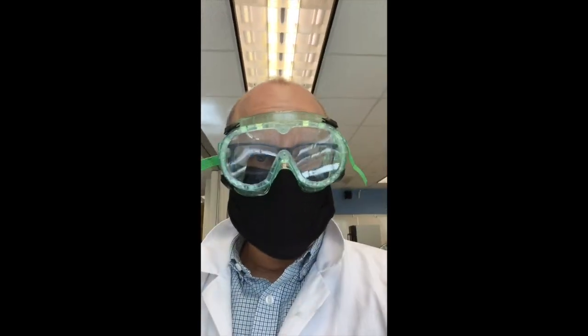All right, so what we're gonna do today though, is we are gonna analyze some food samples to see which macromolecules they have. Do they have simple carbohydrates or monosaccharides? Do they have complex carbohydrates or polysaccharides? Do they have protein in them? Do they have fats in them?